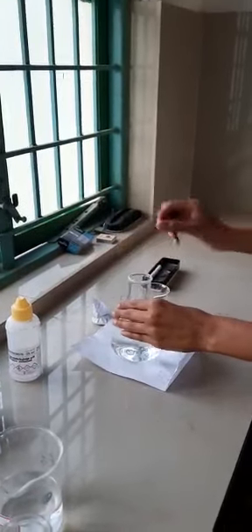So next, the same thing we are going to do with the sample. Discard that. Sample. So this sample contains the oil sample, 1 to 2 ml of fat solvent, and 25 ml of KOH solution, and it is refluxed, boiled for 30 minutes. It's cooled. So take around 25 ml of the sample.